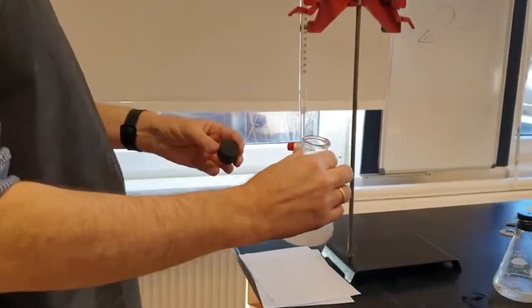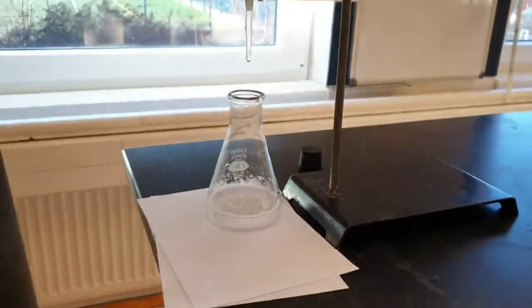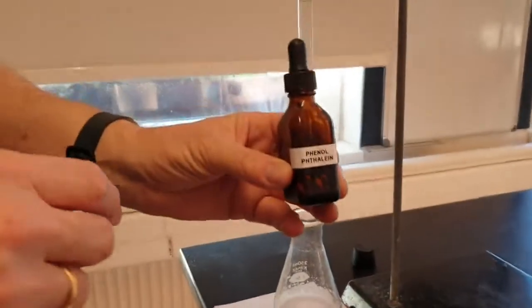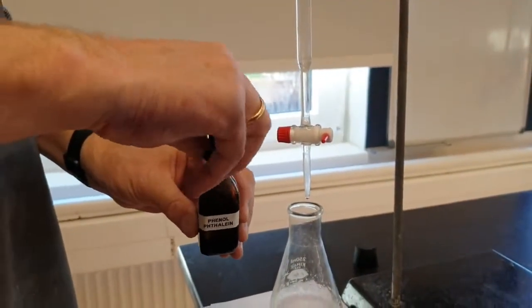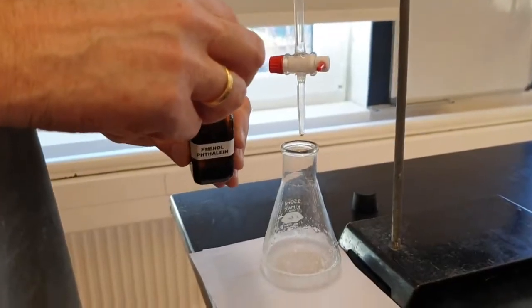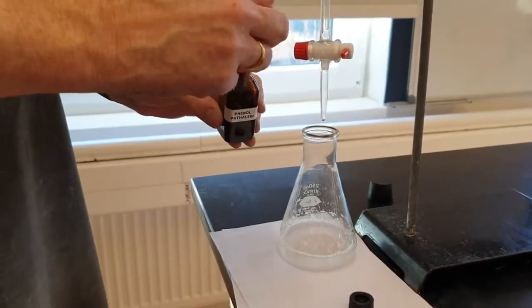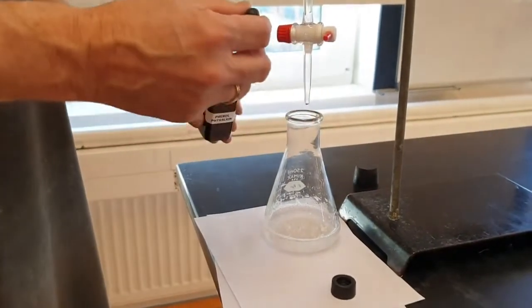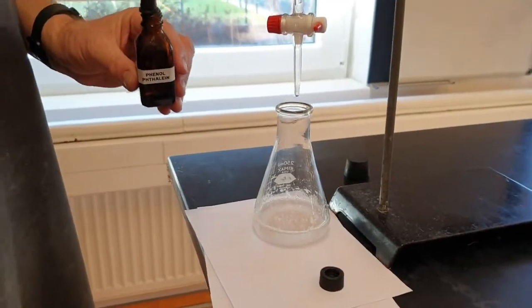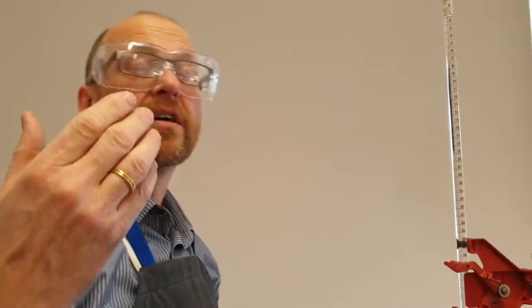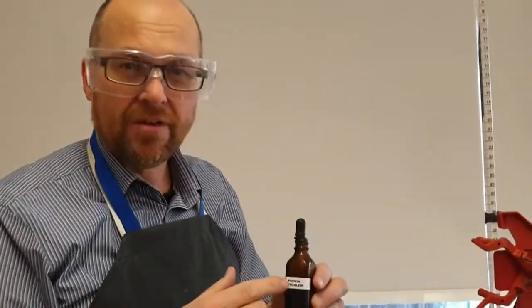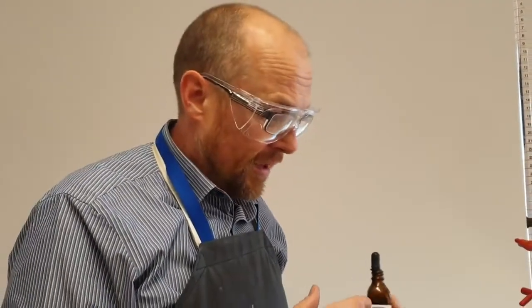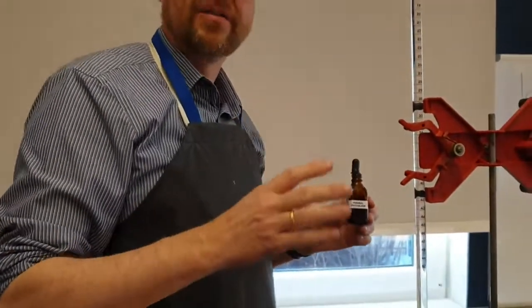Now I've got colorless reactants and colorless products, so I'm going to need to add an indicator. The indicator of choice for this is going to be phenolphthalein indicator. Definitely wash your hands after using this. It used to be the component in laxatives until they realized that it gave you cancer. So here we go. Now if I put too much in, the good news is that the color change will be really obvious. But phenolphthalein itself in this condition is acidic.